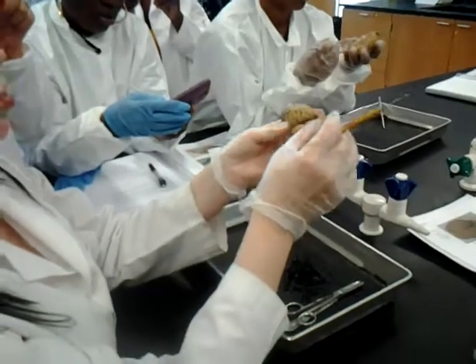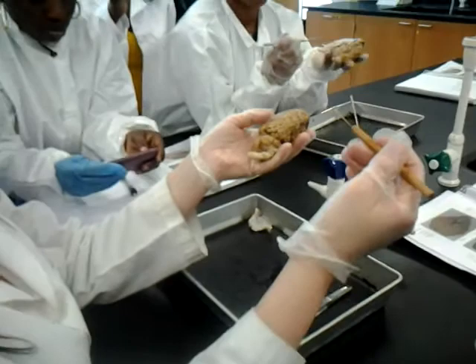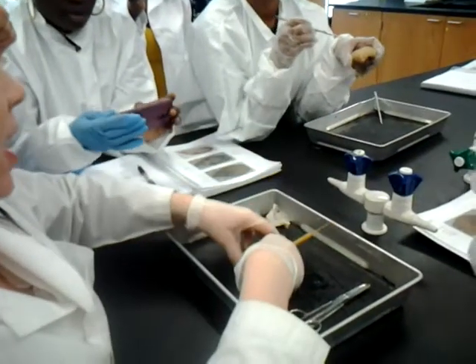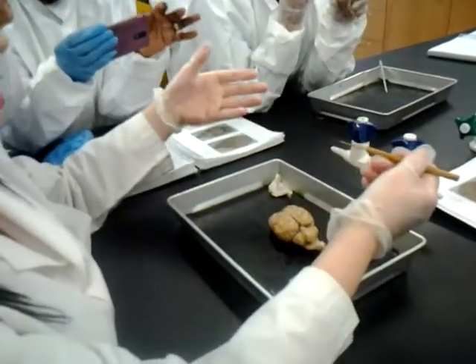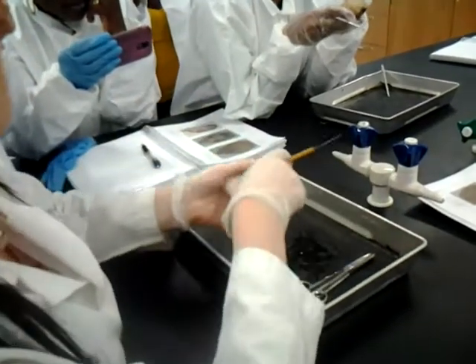Okay, you need to identify the lobes just like you did in the plastic model. Remember, you'll have the plastic model and the actual sheep brain on the lab practical. So we'll stick pins in it in certain places, ask you to identify this or what's the function of this structure, just like we'll do with the plastic model.